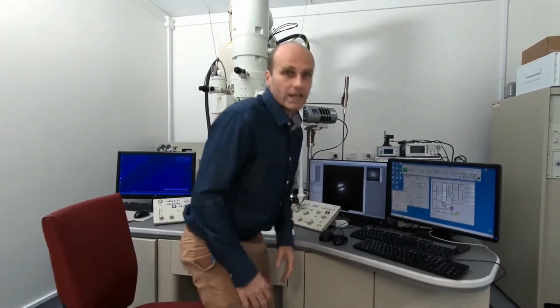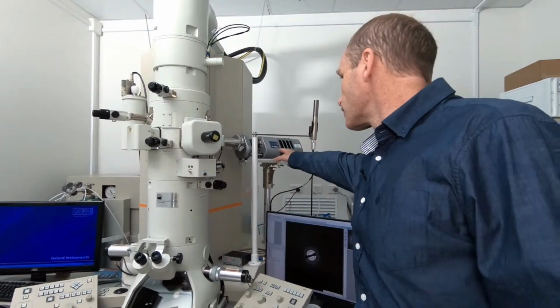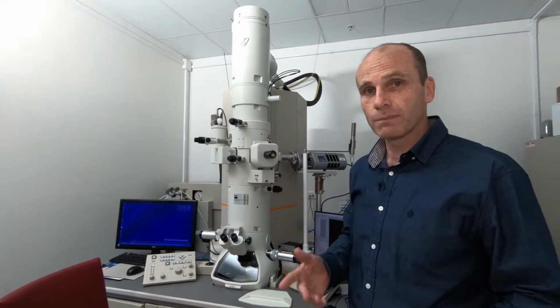Okay, so now we've taken some structural information on our sample and we've also gotten crystallographic information from the diffraction patterns. There's another type of detector that we can use on our microscope, which we haven't used today, and we don't really need it for today's experiment, but it's very useful for a lot of other experiments, and that's the energy dispersive X-ray spectrometer. So that's the instrument that you can see over here, which is attached to the microscope, and this one allows us to get the energy of the X-rays that are given off when the sample is illuminated with electrons. And this is important because these are like a fingerprint for the sample.